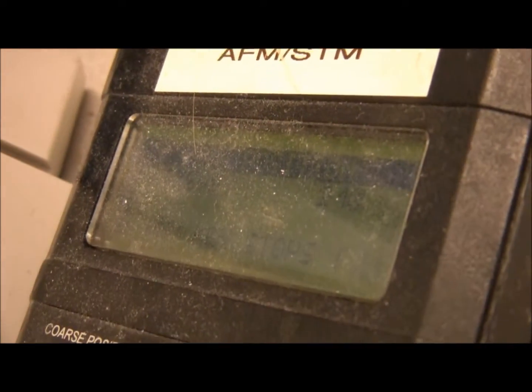This machine right here counts the number of steps. It looks like it's already at 218 steps, and it's done. So it's already reached the point where it's closest to the sample, and it's pretty satisfied with it.